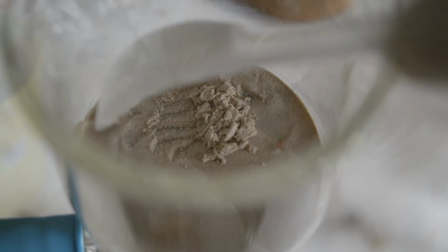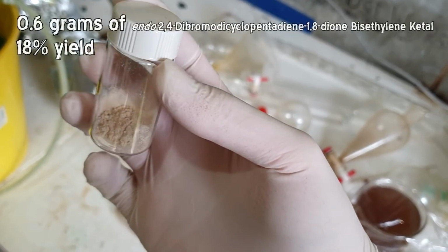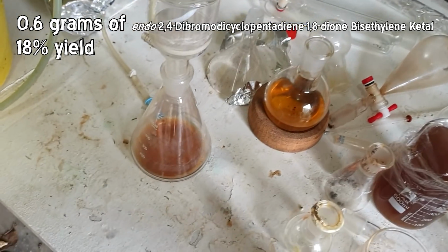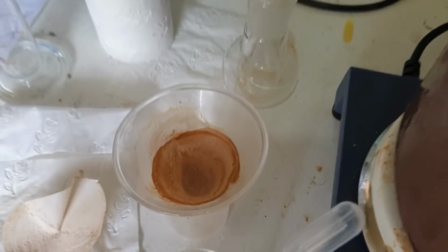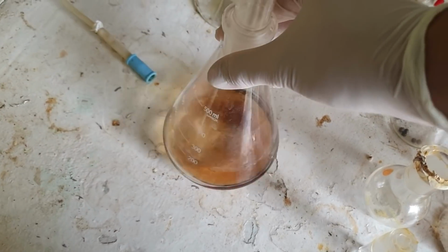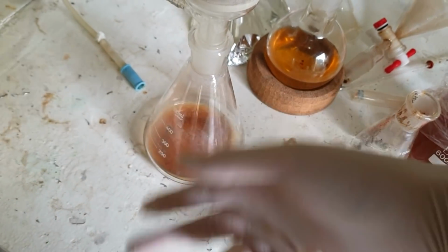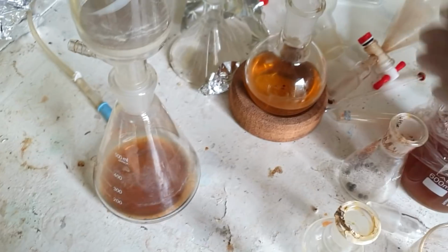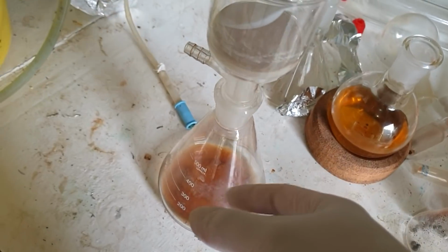Here's our final product. It's only 0.6 grams, which corresponds to a percentage yield of 18% based on our starting reagents. I'm fairly sure all of that has been from the recrystallization. We've got a lot still in this ethanol, and I filtered some out. I think there's some potassium bromide in there, but we lost quite a bit of solid that way. But it's all right. I'll be running the synthesis again, and I'll just reuse this solvent for the recrystallization next time. So we haven't really lost anything here. I'll just carry the yield forward that we lost this time into the reaction next time. I don't think that's really a thing people do, but that's what I'm going to do.